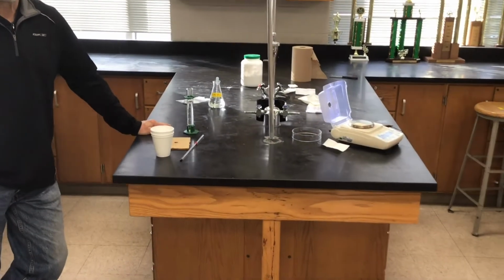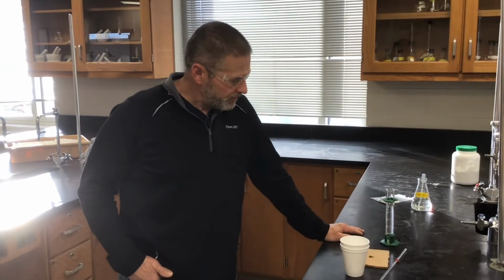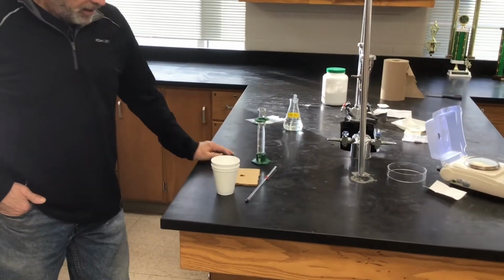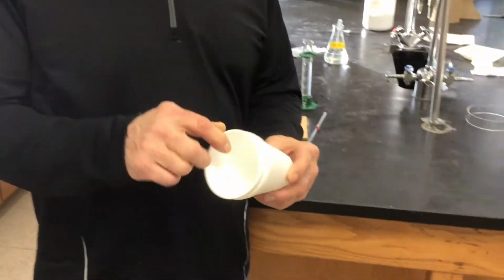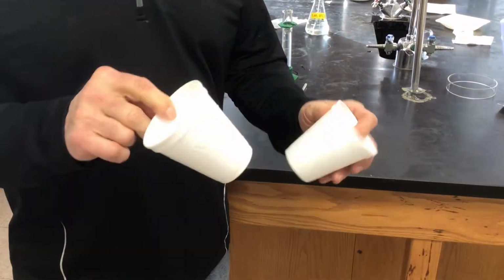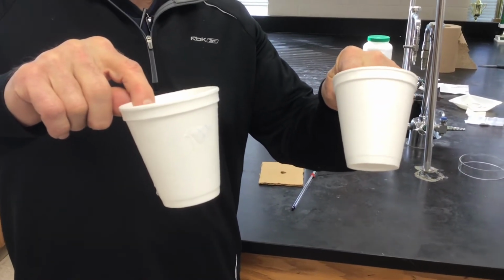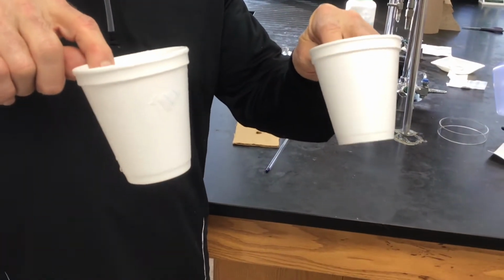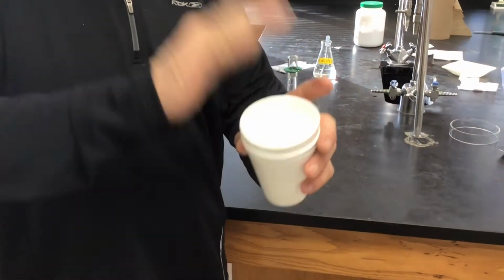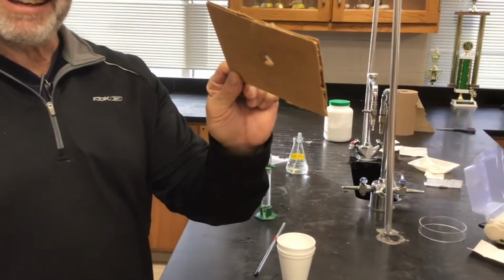Oh, here's an experiment set up for us. Indeed. Here goes our coffee cup calorimetry experiment. People love coffee cup calorimetry because it's dirt cheap, but it's accurate. And the heart and soul of that is our styrofoam coffee cups. And of course in Troy we use only the finest equipment for our students. Students deserve the finest equipment. And not only are we using 1 cup, we're nesting together 2 cups. And we have this precision-made lid.